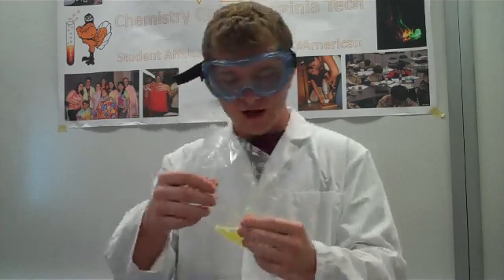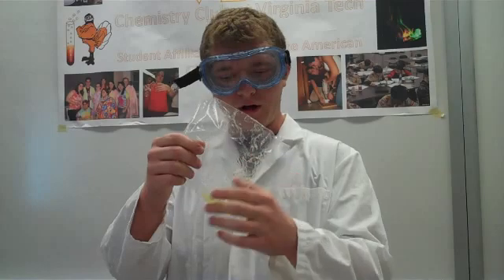Hey there, guys. I'm going to be demonstrating what we like to call slime. This is one of our different kind of demonstrations that we do for a lot of our elementary school kids. This is polyvinyl alcohol in here, and you're going to mix this with a little borax and some food coloring and get slime.